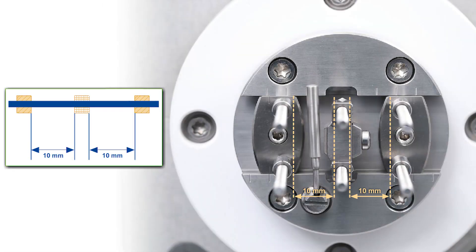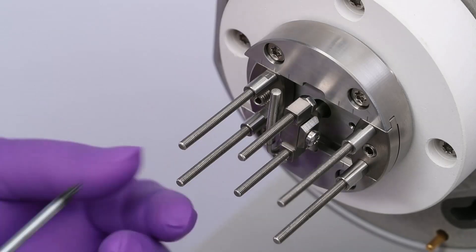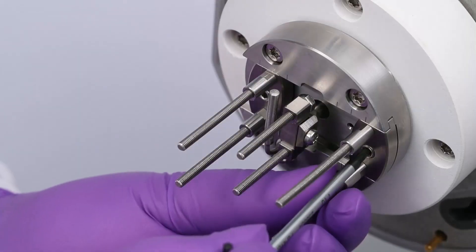The distance between the drive shaft clamp and the support pillars must be 10 mm. If this is not the case, loosen the allen screws on both support pillar pairs and position them accordingly, before refastening the allen screws on both clamps.